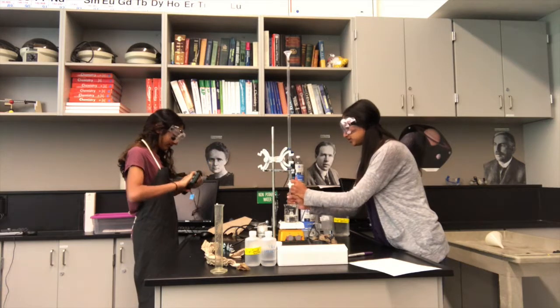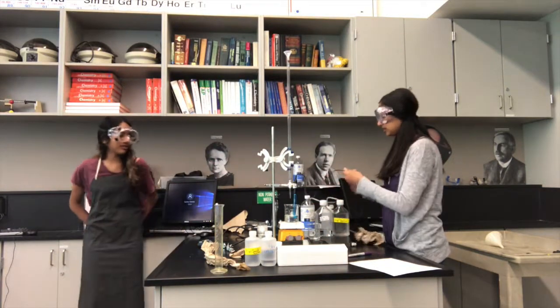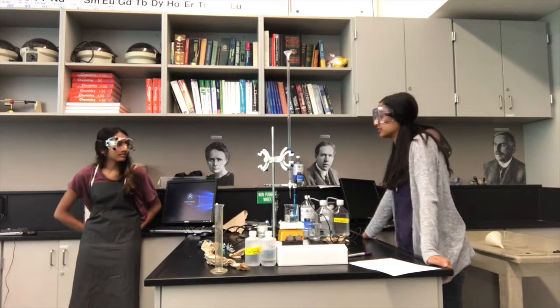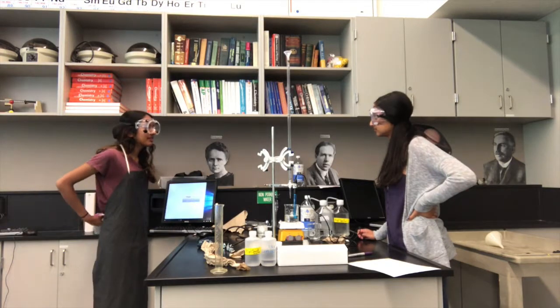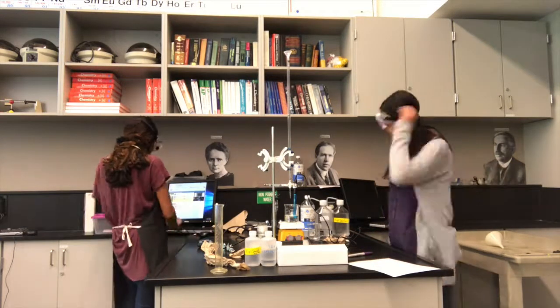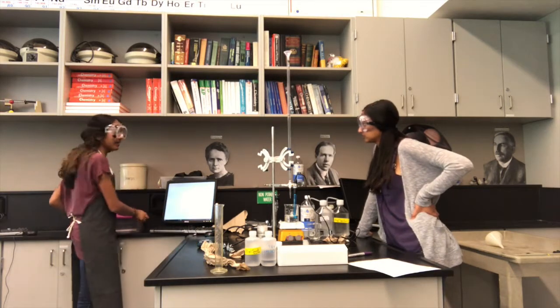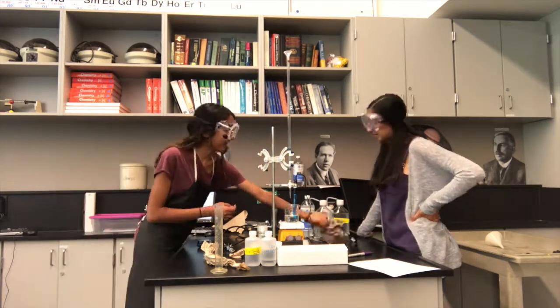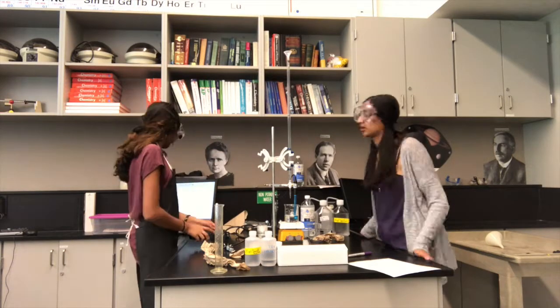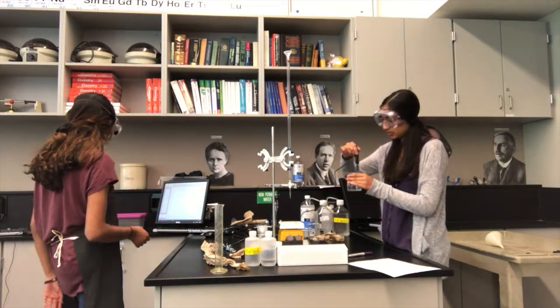Plug in all necessary interfaces into the computer. Go ahead and have a chat about life while you wait. And when the computer still doesn't load, continue on chatting. Open up LoggerPro as appropriate. Plug in the pH sensor into the Vernier connector. Swirl the seawater around with the pH meter in order to stabilize the pH.